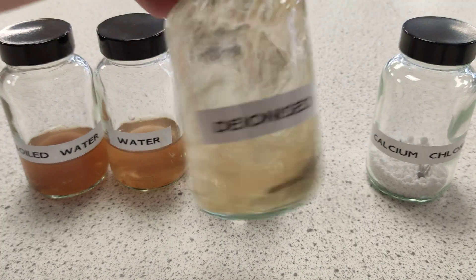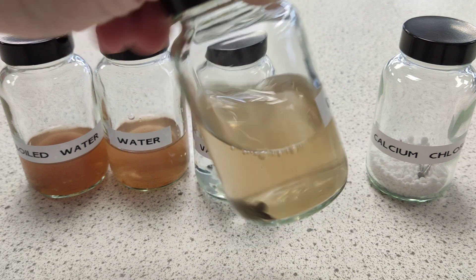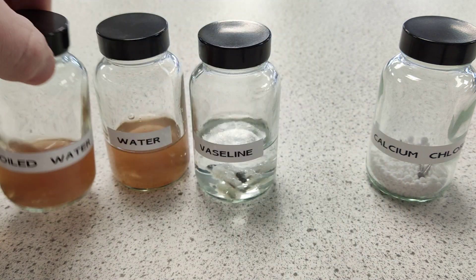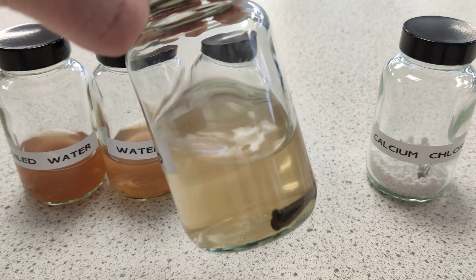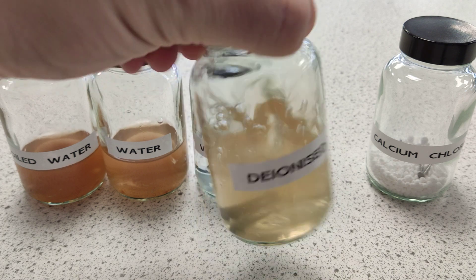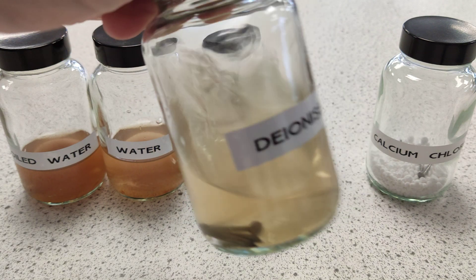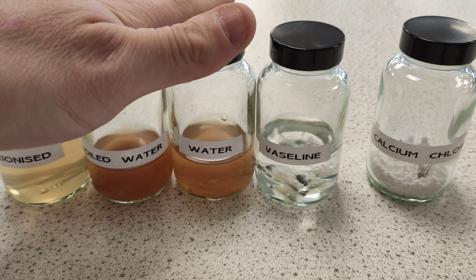This one is a little bit less rusty than the others, but part of that reason is because I started it afterwards - I failed to make much progress with the boiled water so I thought I'd try deionized. It still does it though - it's got enough in there to be a problem because it's got iron, oxygen, and water. So it's not the ions that create the problem, it's the iron, oxygen, and water combined.